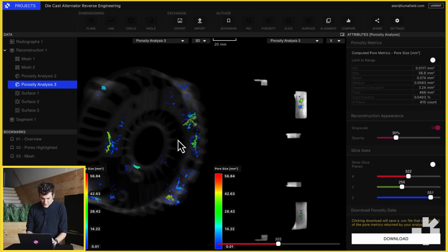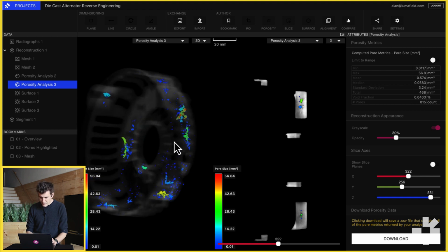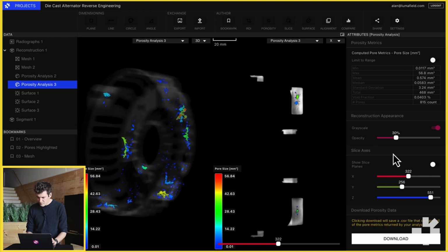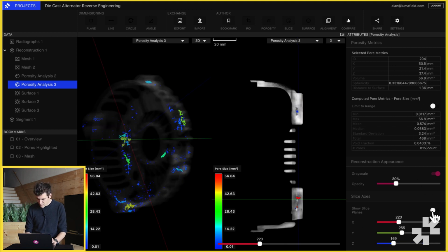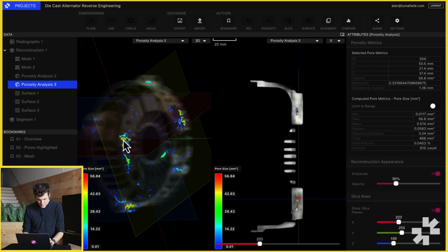We can visualize porosity data both in 3D here on the left and 2D here on the right. Clicking on an individual pore will select it with crosshairs and highlight its individual pore metrics here on the right. To give ourselves more spatial context, we can turn on the slice planes.